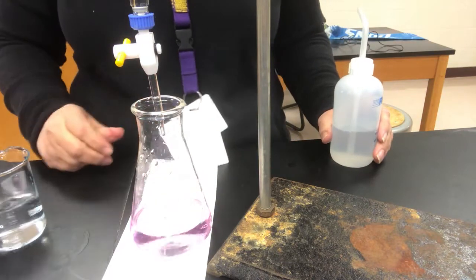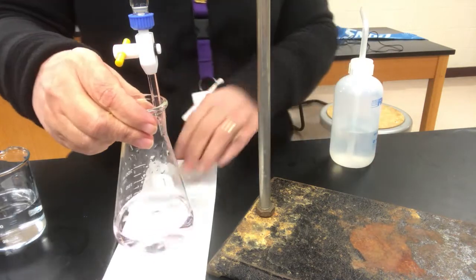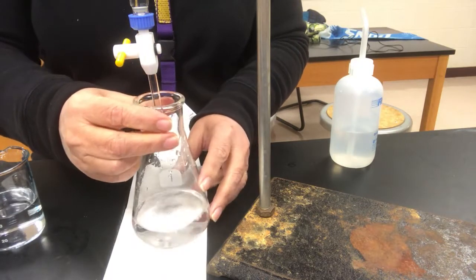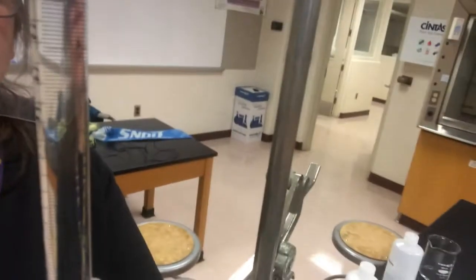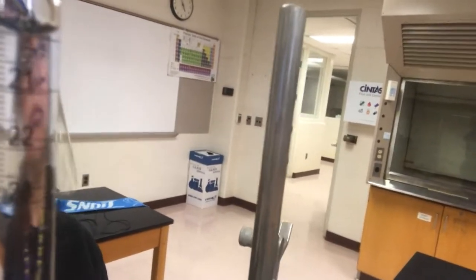Boom. And that's it. That's pretty good right there. So it's fading. It's fading pretty fast. Hopefully you could see it. But I'm confident that that's the end point. Oh, it's faded. That faded really fast. So tell you what, I'm going to add one more drop, but let's take a reading first, just in case. So I'm going to push you guys back up here, because I don't know if it lingered for the required amount of time. It should be there for 30 seconds anyway, and it seemed like it faded pretty darn fast.